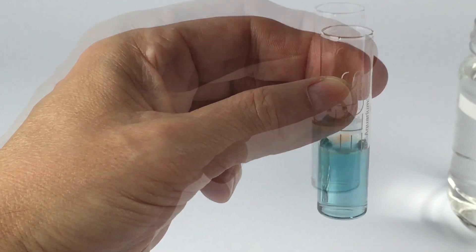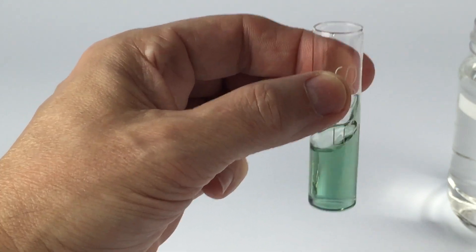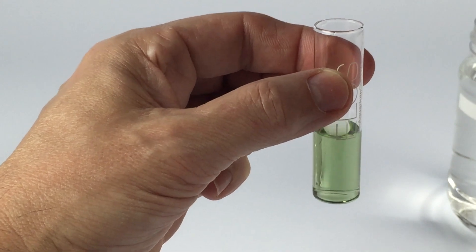So if you use 10 drops your tank would measure 5 dKH. In this case I'm speeding up the process and I ended up using 20 drops which comes out to 10 dKH for my reef.